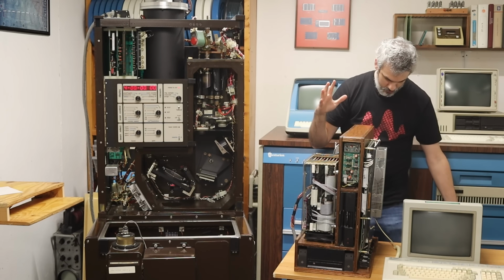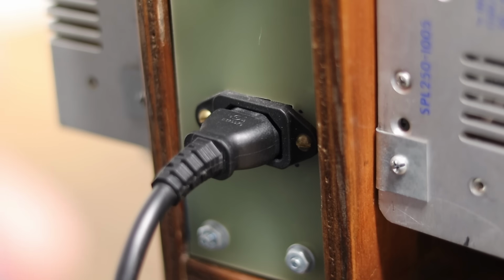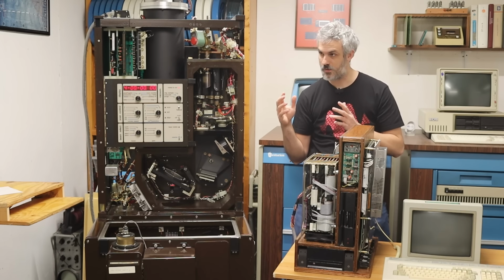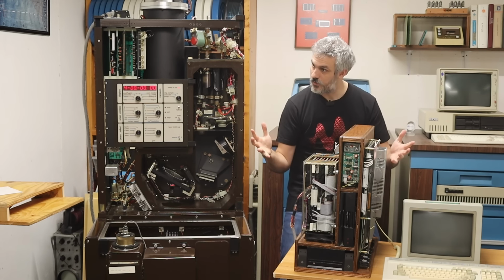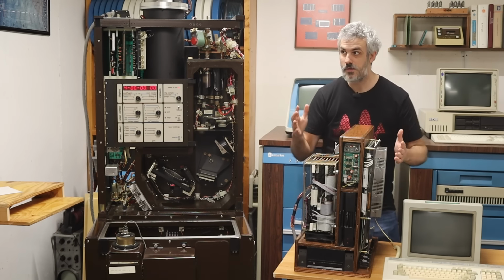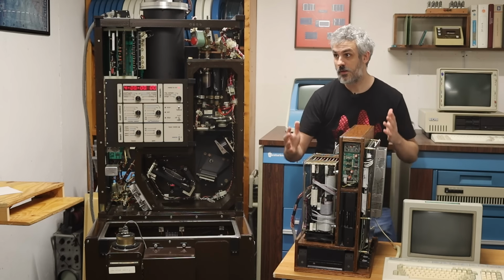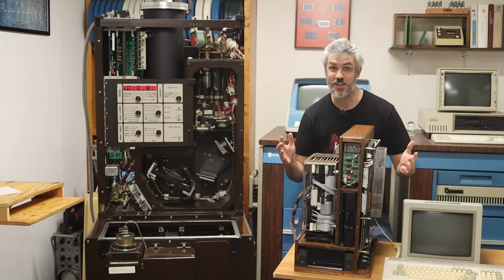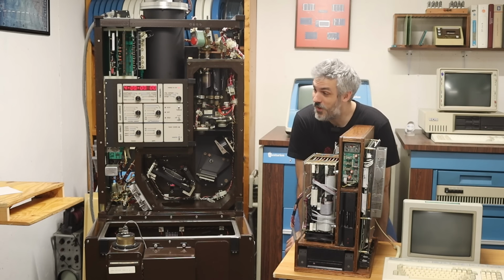Let me unplug the monitor from the outlet. Let me unplug the PDP-11 from the outlet. I have no idea.